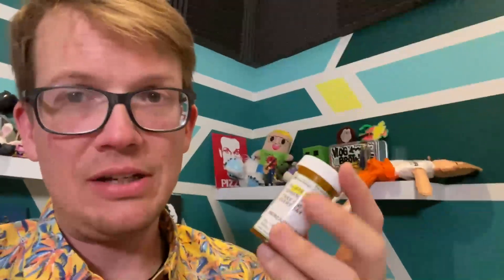I'm going to prepare a slide from this sample I just took at a wetland. I put it in a pill container — this is a good sample container. I have a lot of these because I have ulcerative colitis, so I have a lot of prescription drugs. I haven't looked in it yet, but it's from a warm pond, and warm ponds have life in them. We're going to see what's in this thing, and then I'll show you bright field, dark field, and some oblique illumination filters.